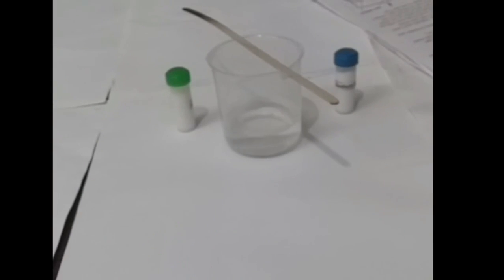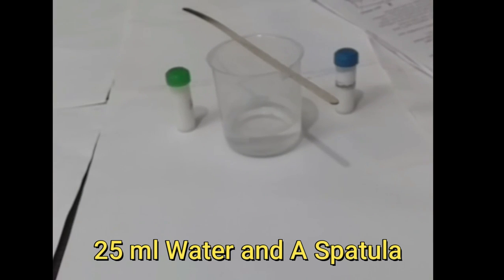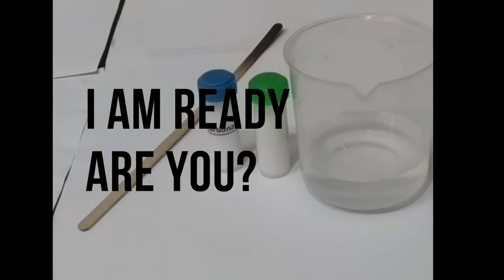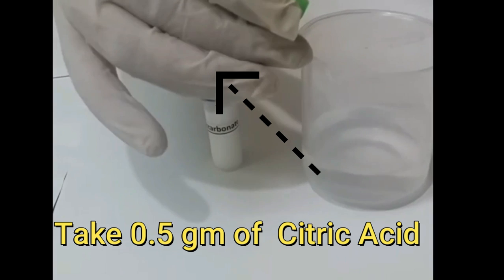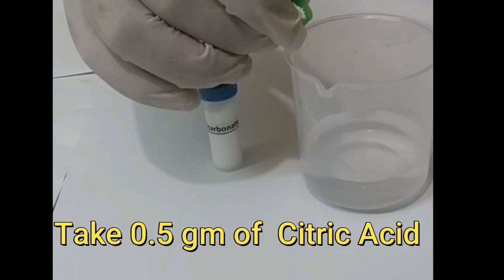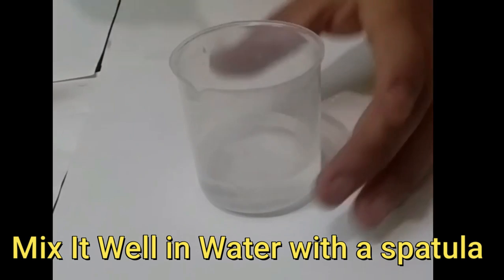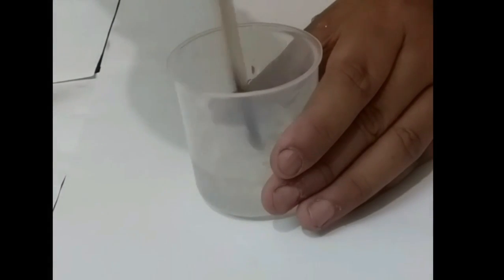Starting off by taking citric acid and sodium bicarbonate, we take 25 milliliter water and a spatula, and we wear gloves just for safety. I'm ready. Are you? I think yes. Take 0.5 gram of citric acid. I'm taking powder form. You can take acid also if you want. Mix it well in water with a spatula.